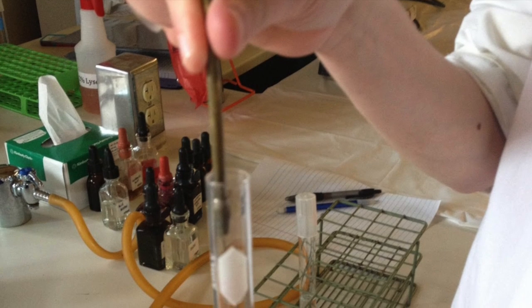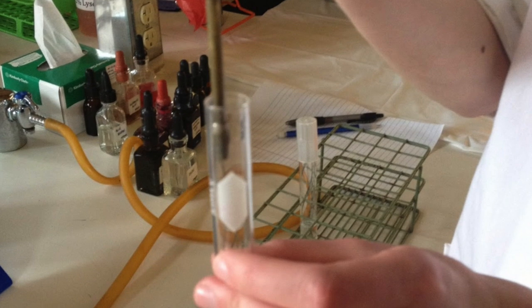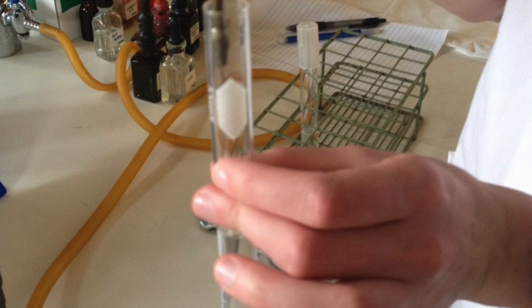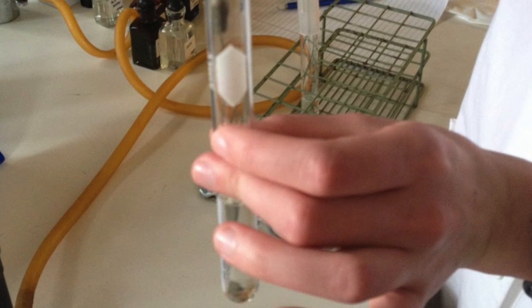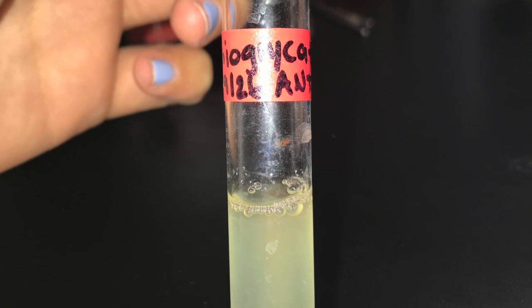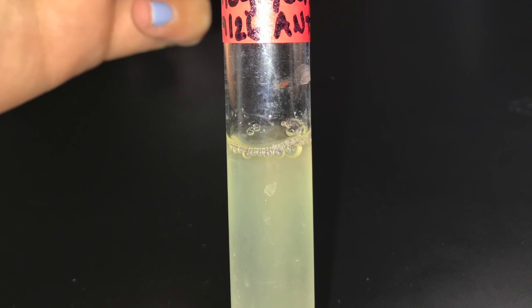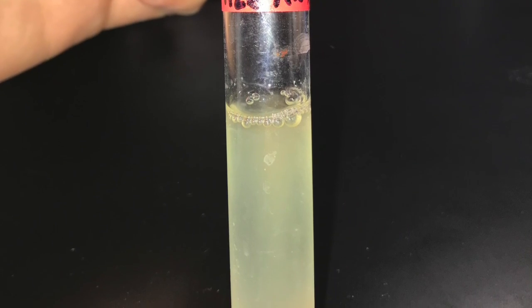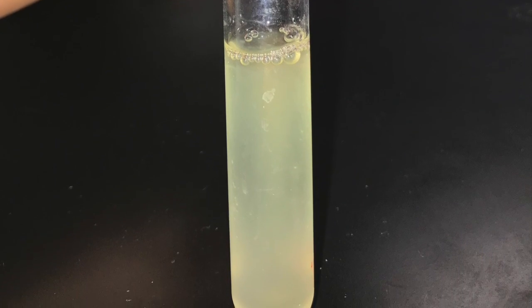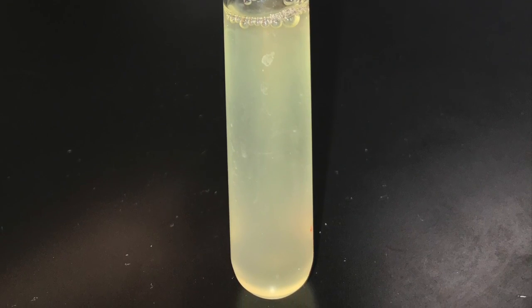For the thioglycolate test, we obtained a test tube filled with thioglycolate, and without swirling or mixing the tube, we inoculated our bacteria straight to the bottom of it and incubated overnight at 30 degrees Celsius. Finally, we tested Citrobacter freundii to see if it grows best, or in some cases at all, in the absence or presence of oxygen. Looking at our results, we observed that Citrobacter freundii is a facultative anaerobe because there was an equal amount of growth that occurred throughout the whole test tube. Therefore, it can survive in an environment with or without oxygen.